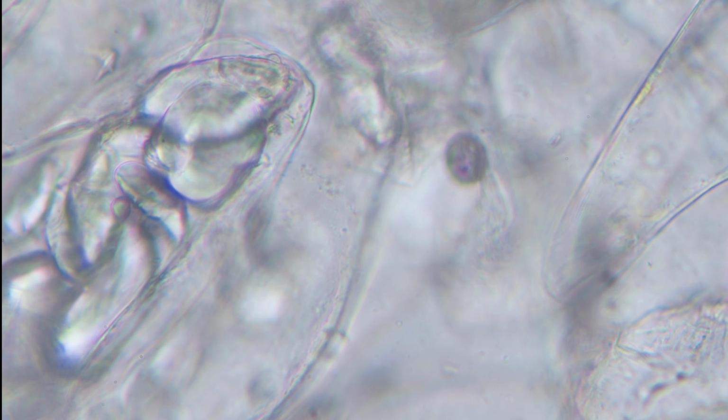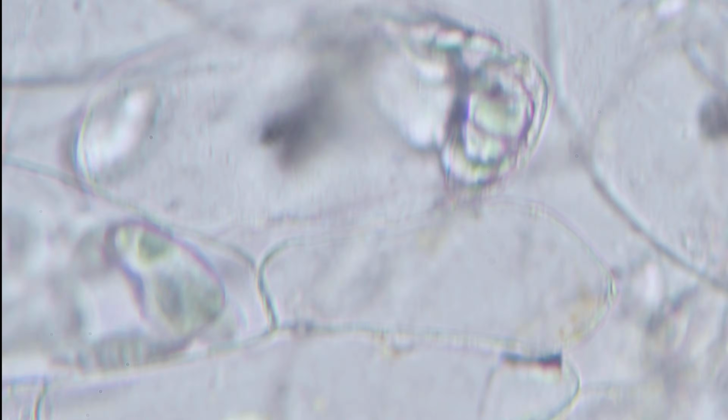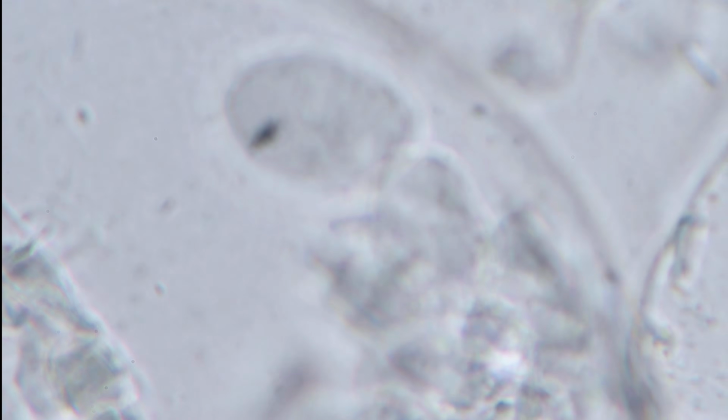I'm surprised because sometimes these fruits usually go bad because they've been attacked by, what do we call them? You'll find maggots in here, but I've not seen any. But anyway, maybe we might find that in the one which is rotten. But this is how a normal banana would look.